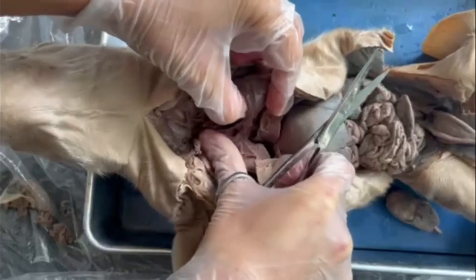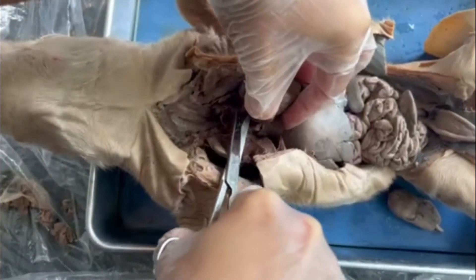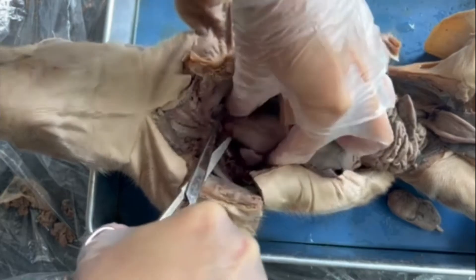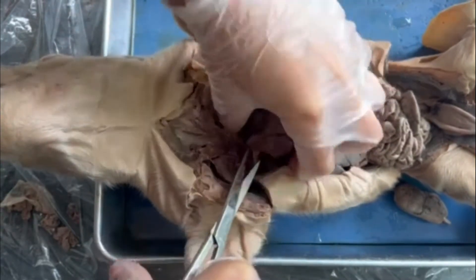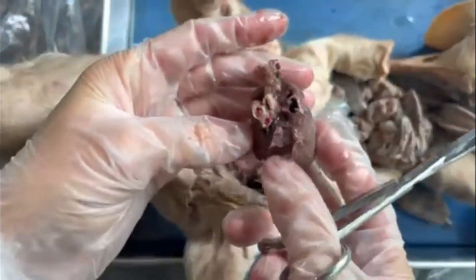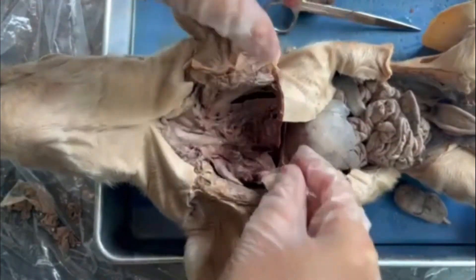I'm carefully keeping lifting the heart out while trying not to damage any lung tissue. I need to cut the pulmonary artery down here as well. The heart is loosening as those last blood vessels snip. You can see the back of some of the blood vessels — that's where the superior and inferior vena cava would have dumped into the right side of the heart. There's our heart, and now we're able to see a little bit more of the respiratory system than we could before.